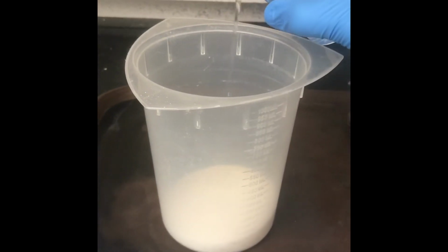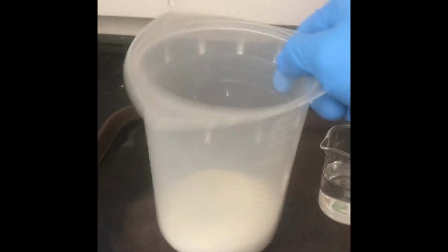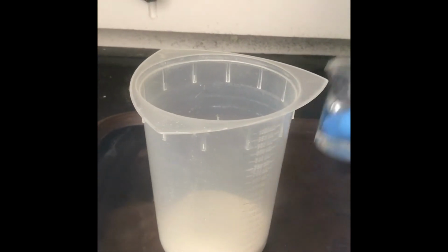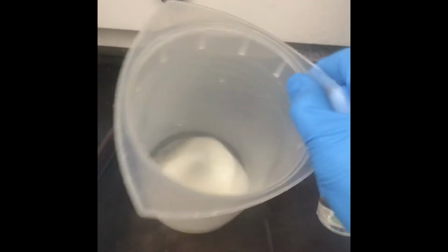We begin by adding a small amount of water to the sucrose in the container to let it dissolve. For the concentration of sulfuric acid that we'll be using, it's important to complete this step to eliminate the time delay that usually happens at the beginning of the reaction. We keep adding water until we develop a thick paste of sugar.